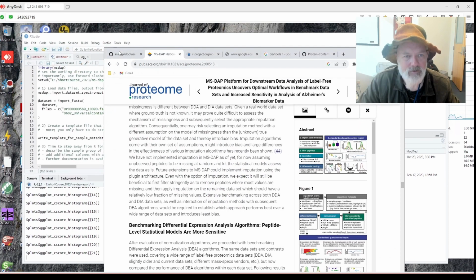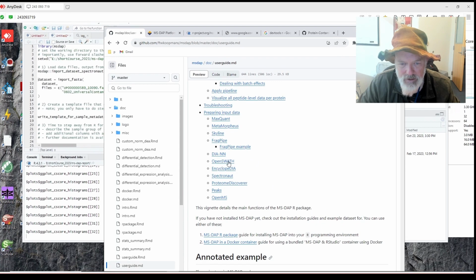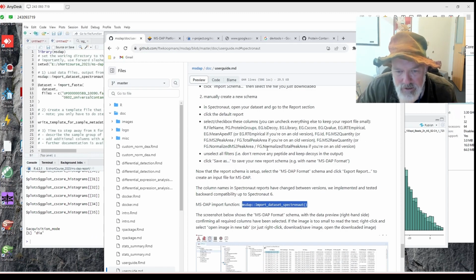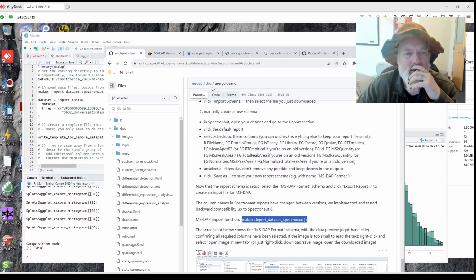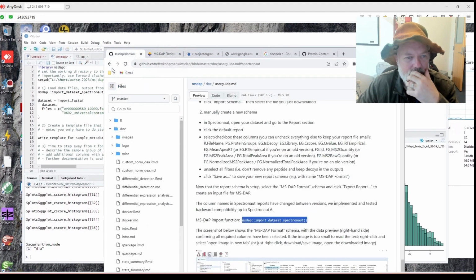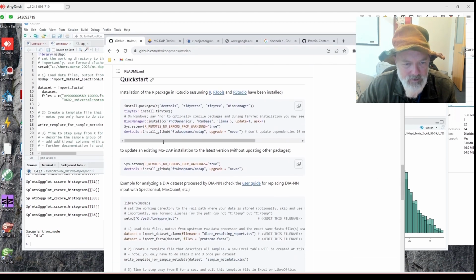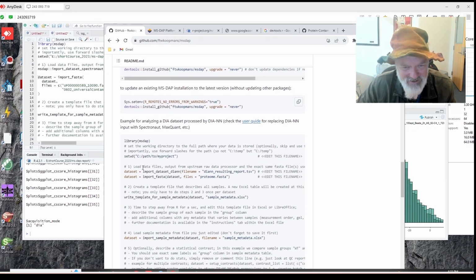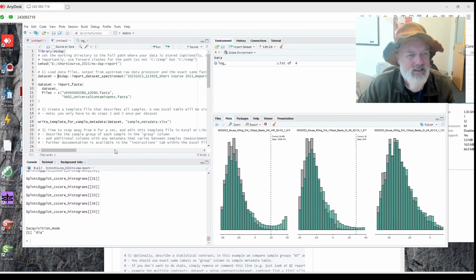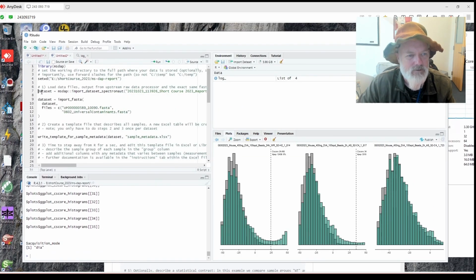Something wrong here? I don't think so. Let's see, import Spectronaut, downloading report schema. I think that's all it did. Oh, maybe I did that. Oh, I know what I did wrong. Okay, so we'll go back to Quick start. Yes, that was dumb. Okay, so data set equals. I didn't give it an object. Okay, that's dumb. All right. Data set equals. Yes. All right.